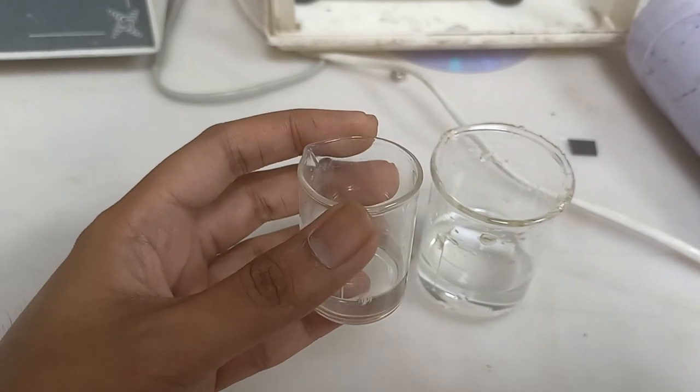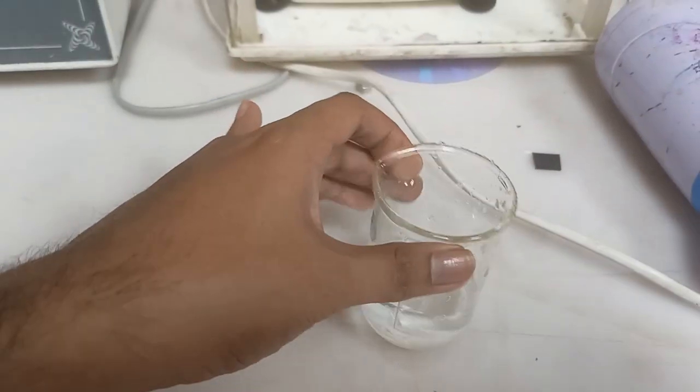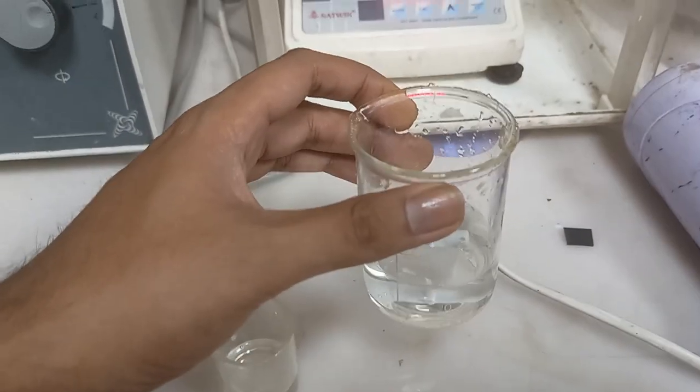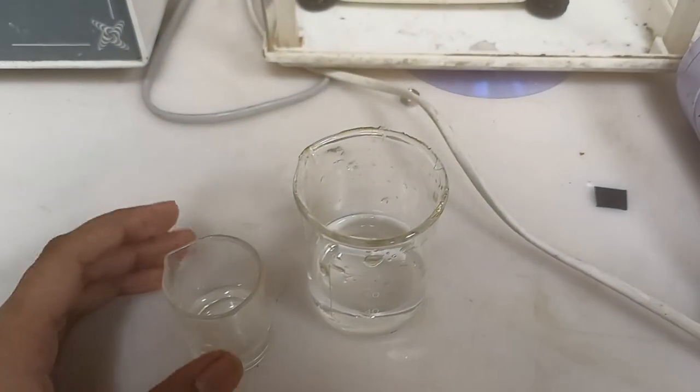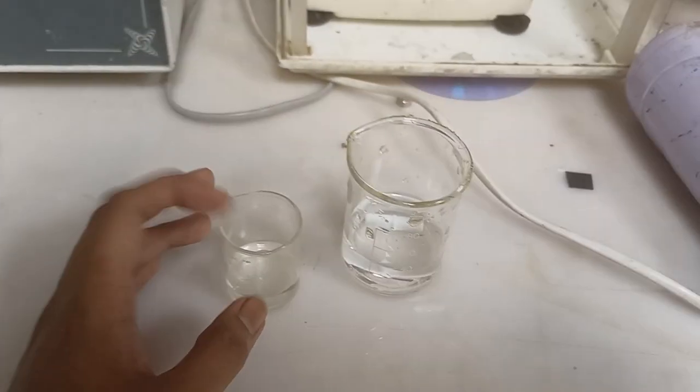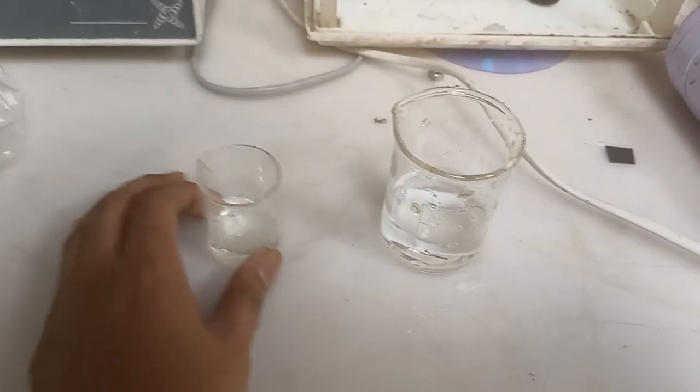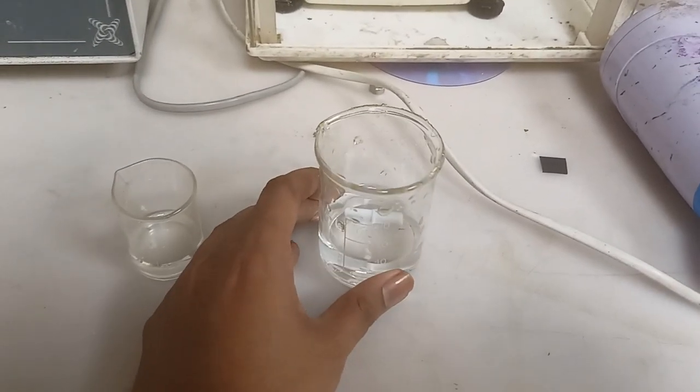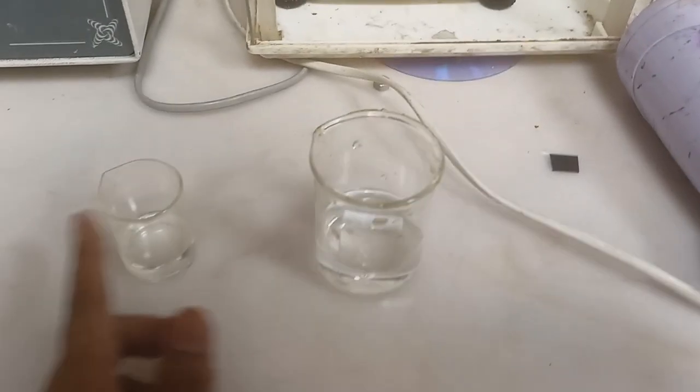Here I have taken 10 ml of water and this is also 10 ml, this is around 40 ml of water. What I am going to do is measure Methylene Blue and mix it with it. This will be my master solution. Here I will mix tin chloride and hydrochloric acid, and then add both.